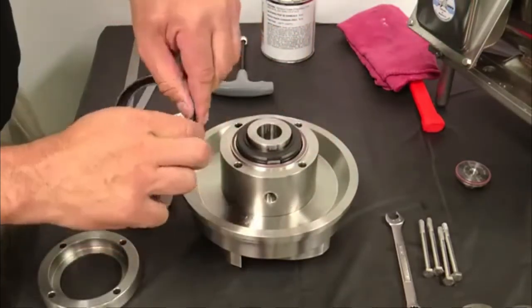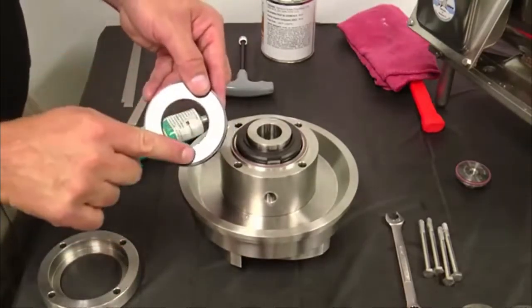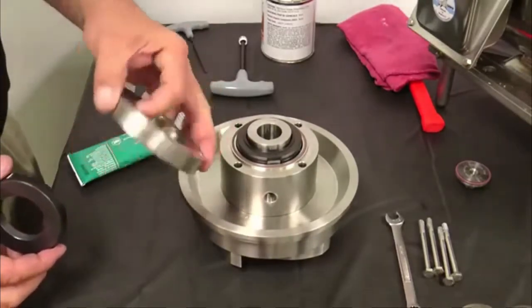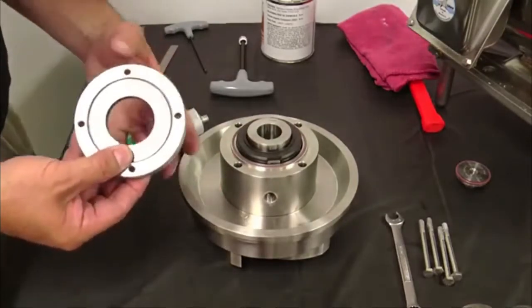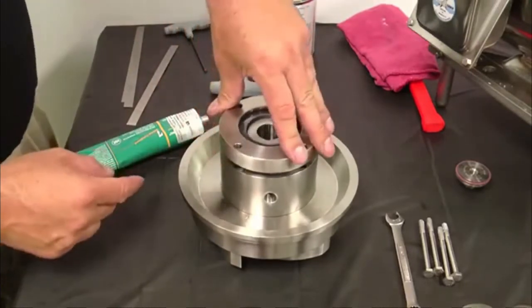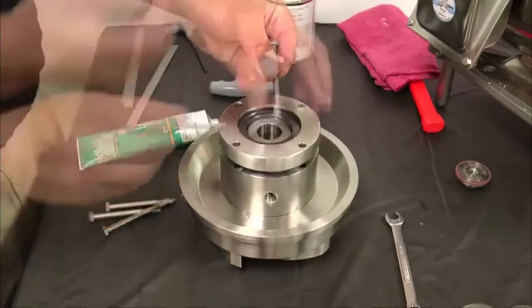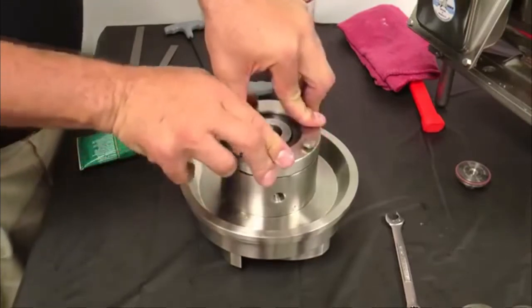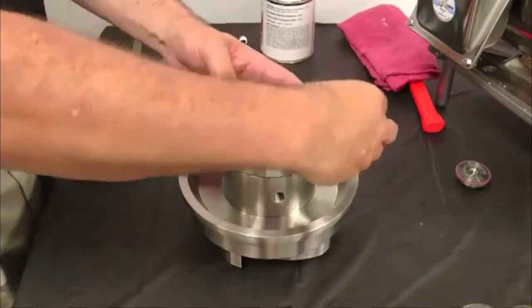Assemble the lubricated L-gasket and the seal seat together, making sure the new side of the seal seat is exposed. Install the lubricated L-gasket and seal seat into the seal retainer with the new seal face facing up. Line up the mounting holes and install the seal retainer onto the seal housing. Lubricate the four cap screws with anti-seize compound. Install while pushing down on the seal retainer to compress the seal springs and install the four cap screws by hand, then tighten using a 7/16th inch wrench.